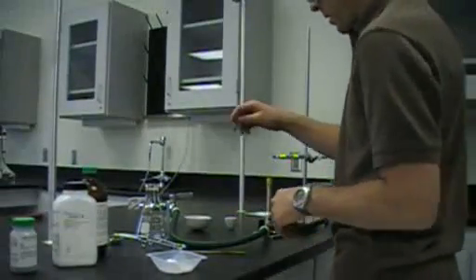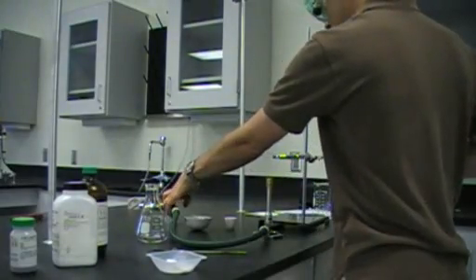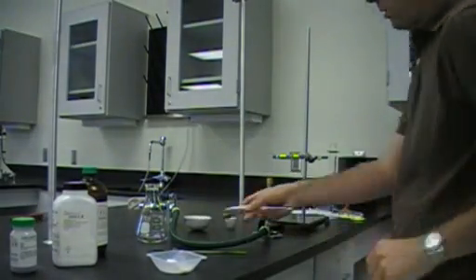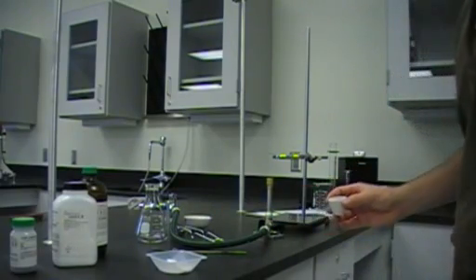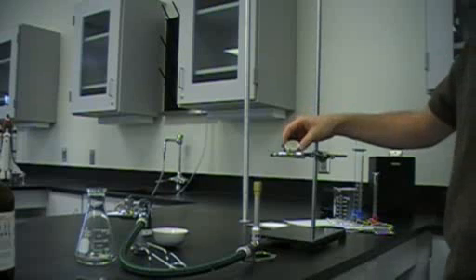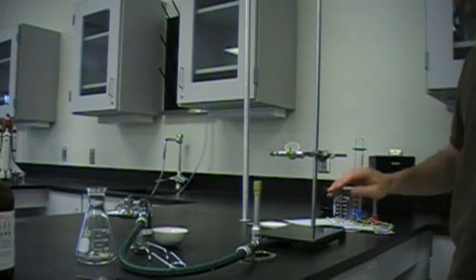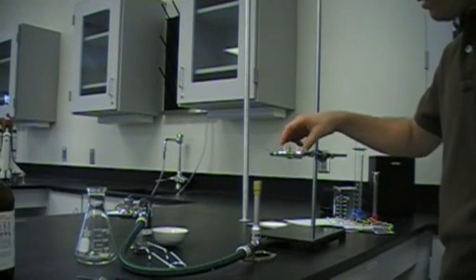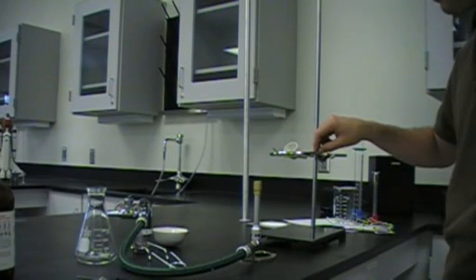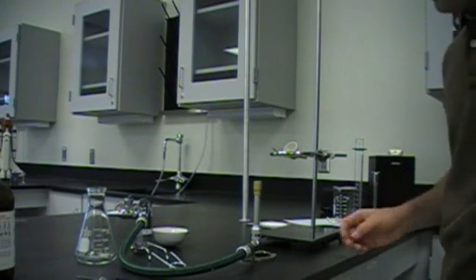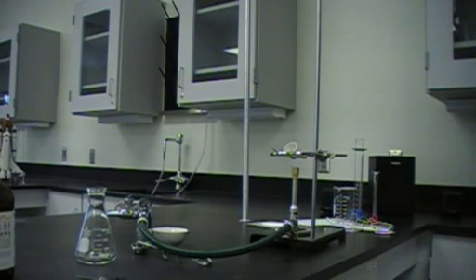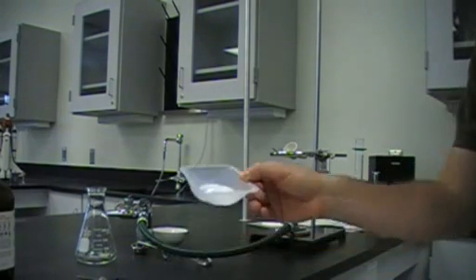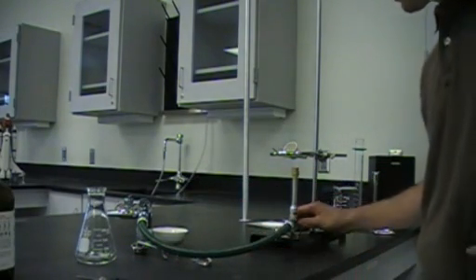All right, next thing, we are going to get the burner lit. And really the main thing, crucibles, they are kind of flat on the bottom. And it's nice if they can kind of get heated a little more evenly, kind of if you go across the bottom. So what we are going to do is, it sets in the triangle like so. So it is used exclusively with the triangle. And now as we put our flame underneath, instead of just heating the bottom of it so that it can all get heated very quickly, we are just going to heat it kind of evenly.